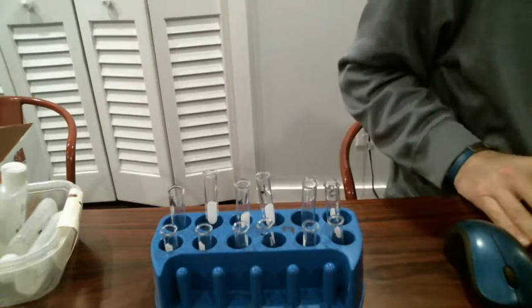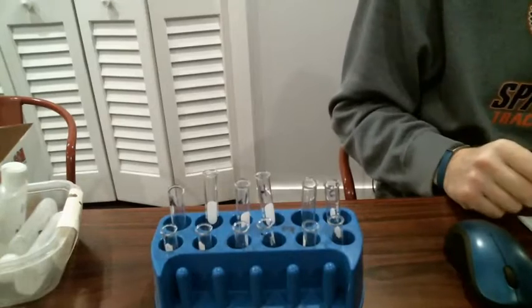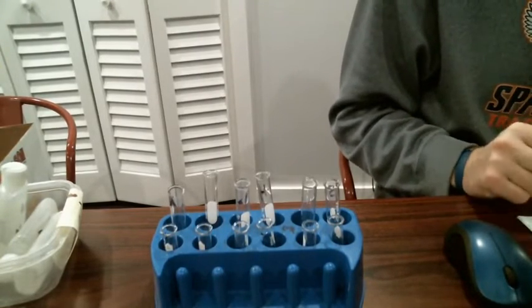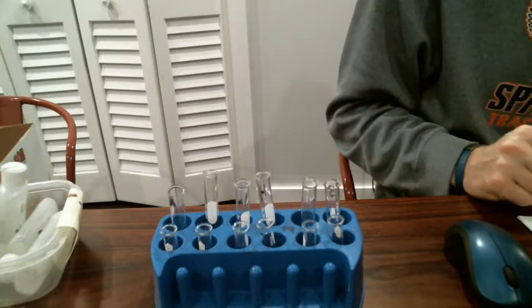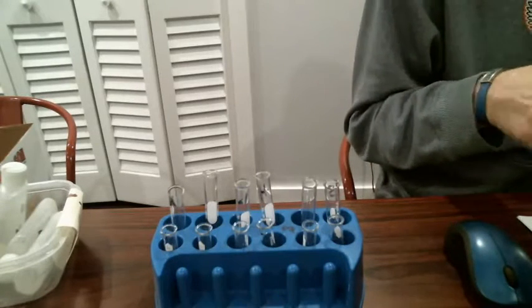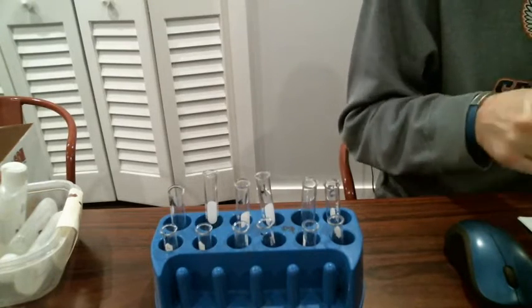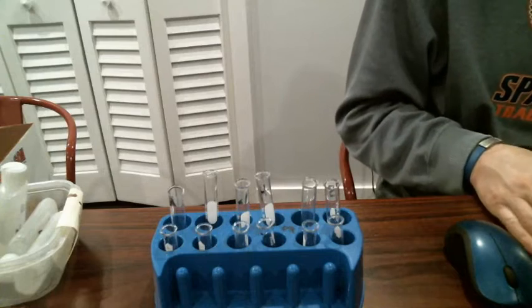All right, so this is going to be a two-part video where we take a look at these double replacement reactions. Now, we should already know from our notes that a double replacement reaction is when we start with two ionic compounds, and the metal ion, or cation, the positive ion, they switch place with each other in those compounds.